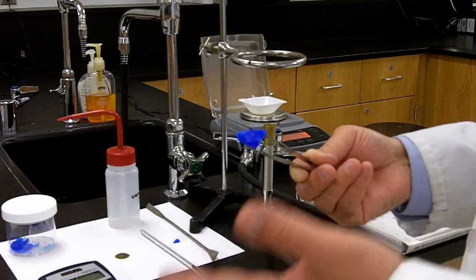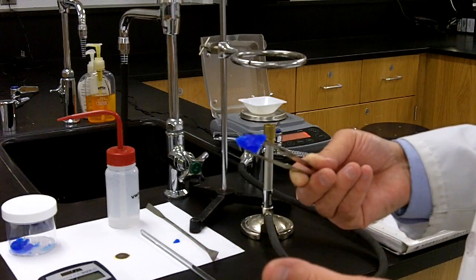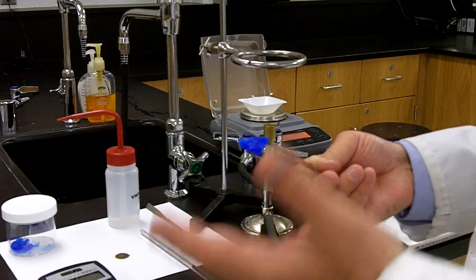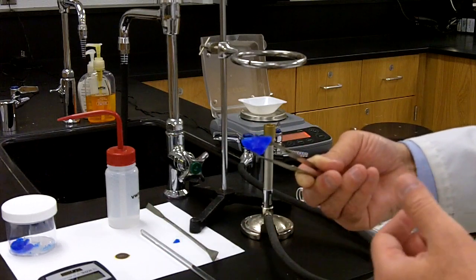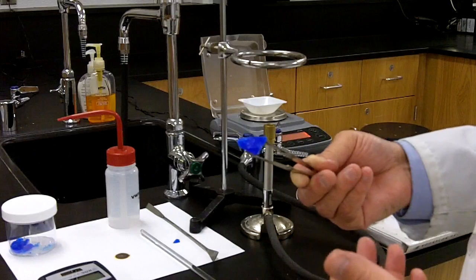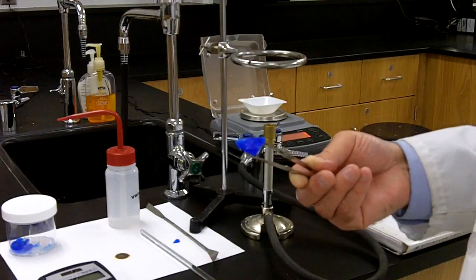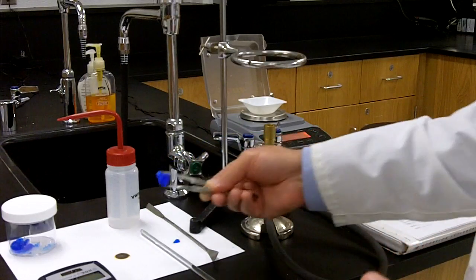We did this in the lecture in our notes, but what we want to do today is compare what we got in our notes to what we're going to get experimentally to look for any kind of error that may have occurred between what we calculate and what we actually do in the laboratory.